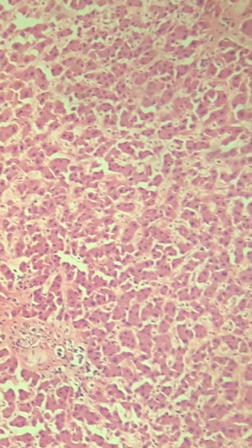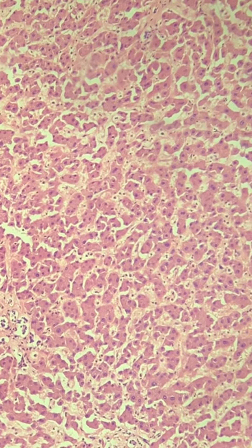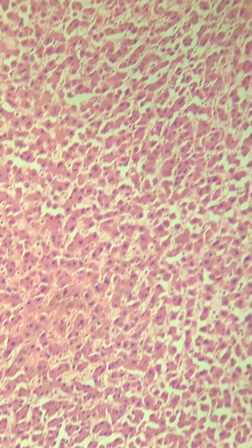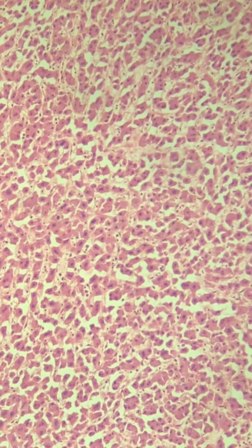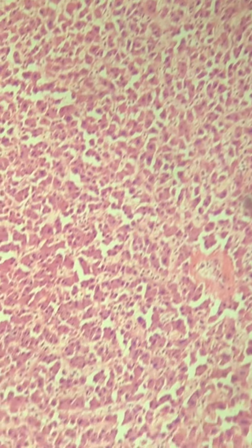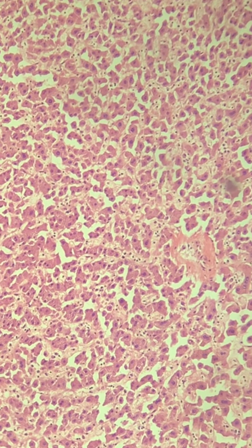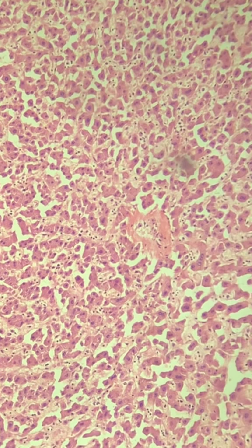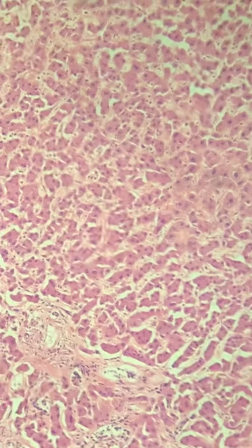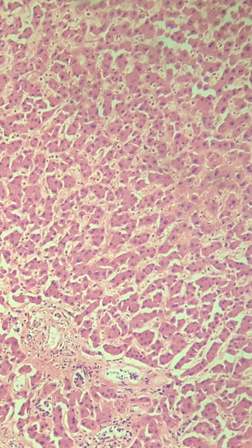As I peruse around, I just want to give you an idea of what a normal liver looks like in a deceased individual. There is no fatty change, no fibrosis or scarring, no cirrhosis. There's slight thickening of the central vein there, but you can see that these are normal, very healthy hepatocytes as we go and take a look at this portal triad.